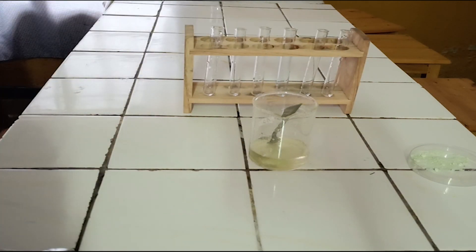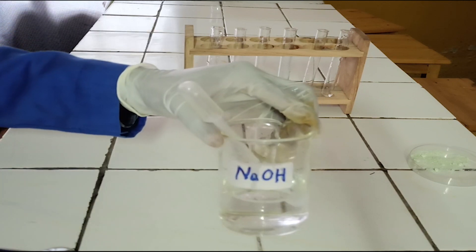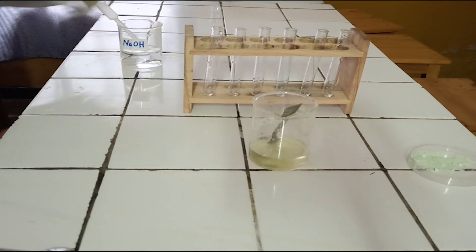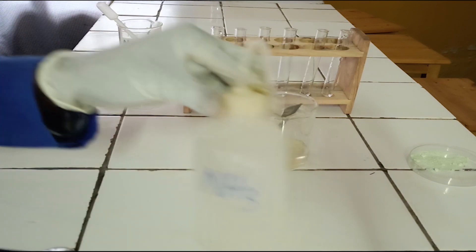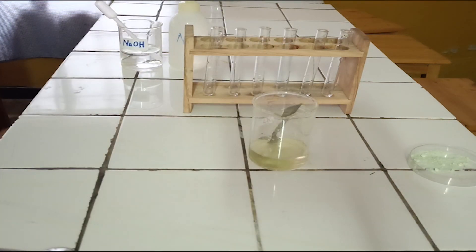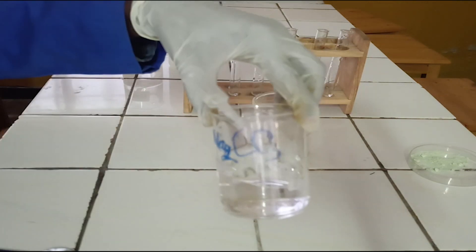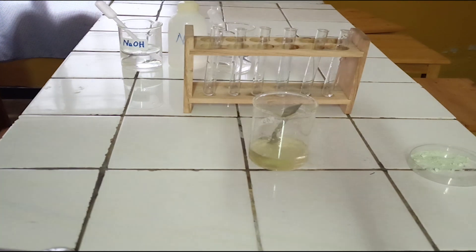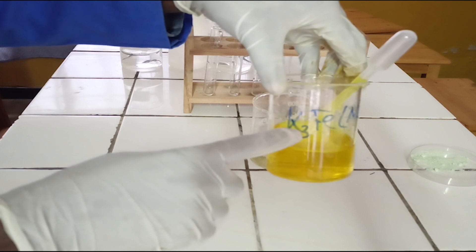Chemicals required: 1. Sodium hydroxide solution. 2. Diluted ammonia. 3. Sodium carbonate solution. 4. Potassium hexacyanoferrate(III).